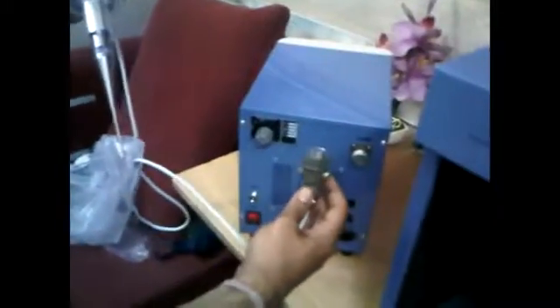Make sure it is tight properly. Once your probe is ready of the desired size, here we have selected 3mm, you have to put it on the generator part. You can see that there is a small cut on this cable and here there is a line to adapt this cut. Insert straight, push it, and tighten the threads and your probe is fixed. Here I'm just sliding the probe and it simply rests on the cover, so our sound reduction box is done.